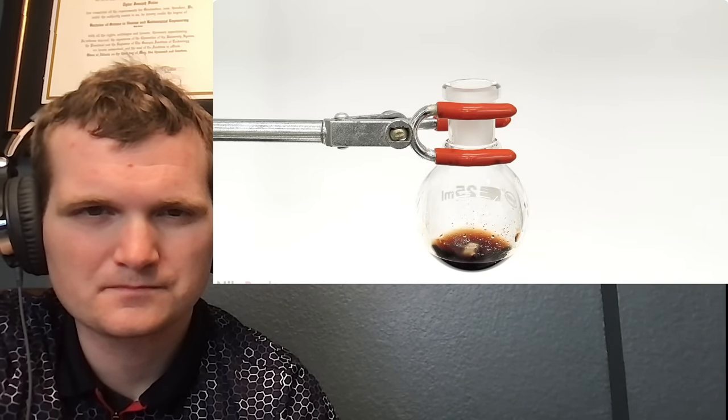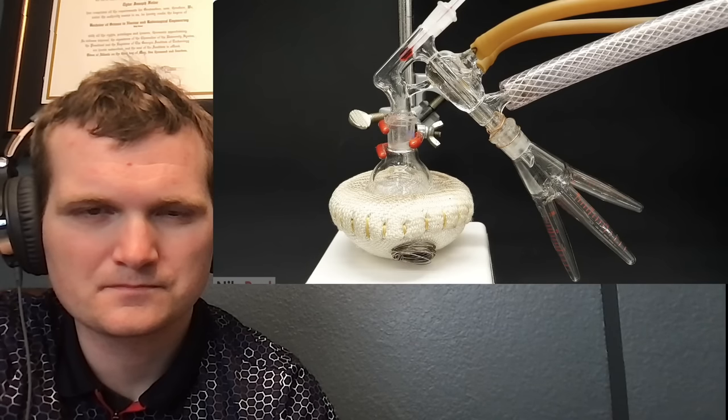What I had now was really crude and dirty methyl anthranilate, so I had to do another distillation, but it had to be under vacuum. Doing it under vacuum was very important because it would let me do it at a much lower temperature and without any air present. This would prevent the grape flavor from decomposing or reacting with oxygen. By the way, in the secondary cycle of a nuclear power plant, the turbine exhaust goes to a condenser — the purpose being to convert steam back into water to feed the steam generators, which form the secondary loop heated by the reactor to produce steam and electricity. One of the reasons a vacuum is used there is to filter out non-condensable gases; without it, it would significantly reduce the heat transfer rate and thermal efficiency. A 1% efficiency change one way or the other is a ton of money, so it's important to maintain those systems very well.